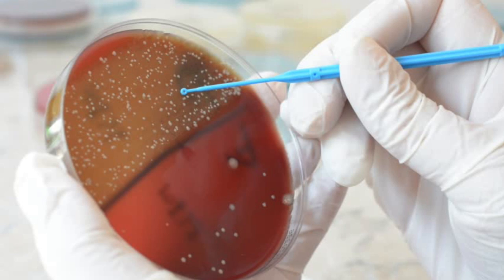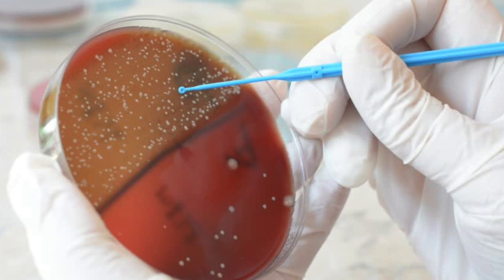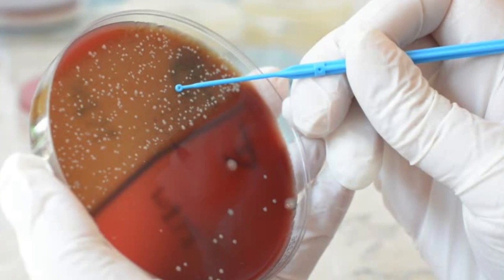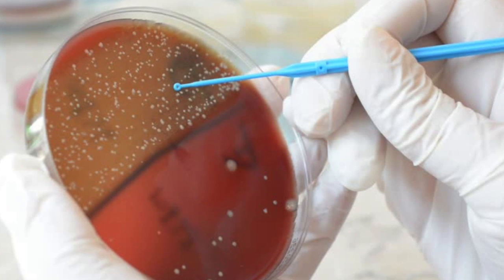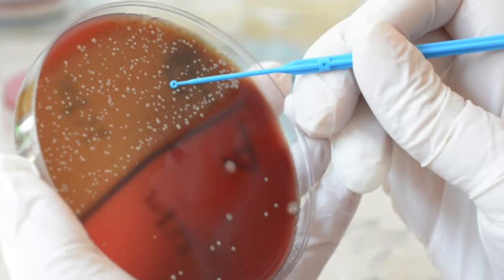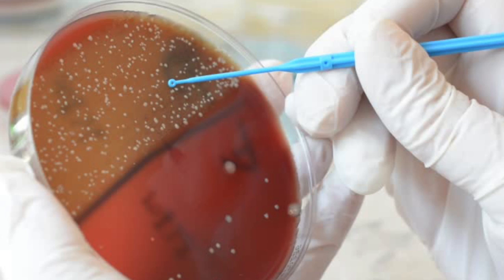For the catalase test, we colonized our bacteria on an agar plate, and then using sterile technique, we picked a colony off of the plate and spread it on a glass slide and dropped hydrogen peroxide onto it. For the oxidase test, we used a sterile cotton swab to swipe bacteria off the agar plate. We then dropped oxidase reagent on the cotton swab and observed.